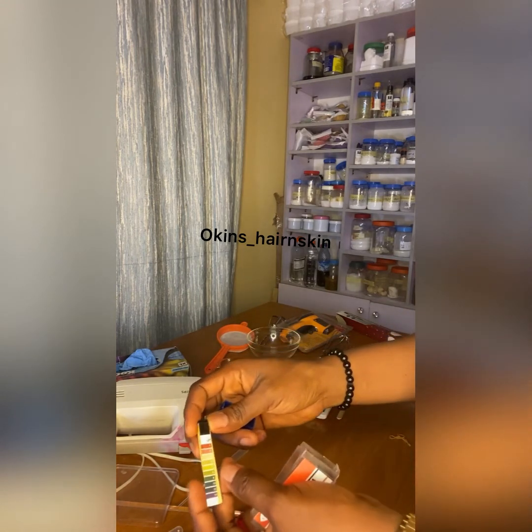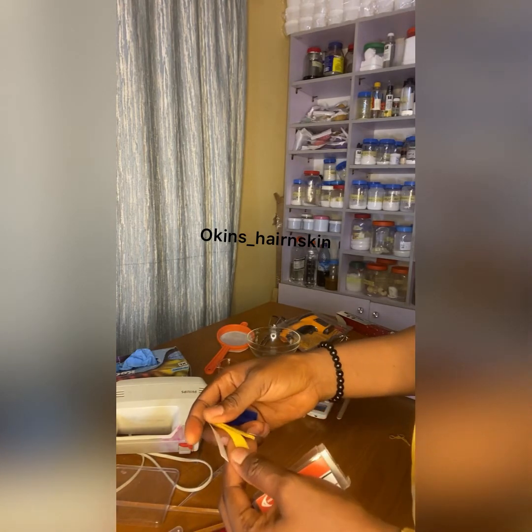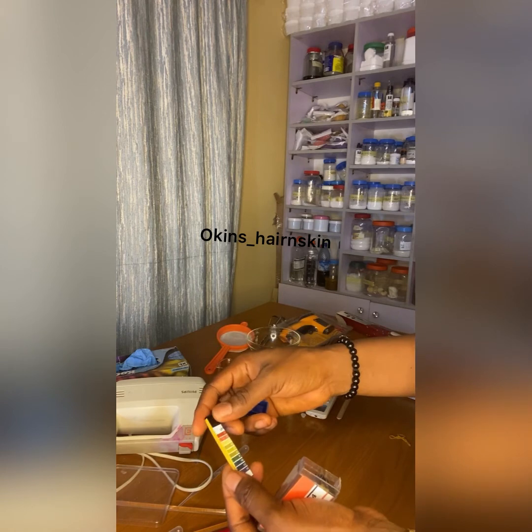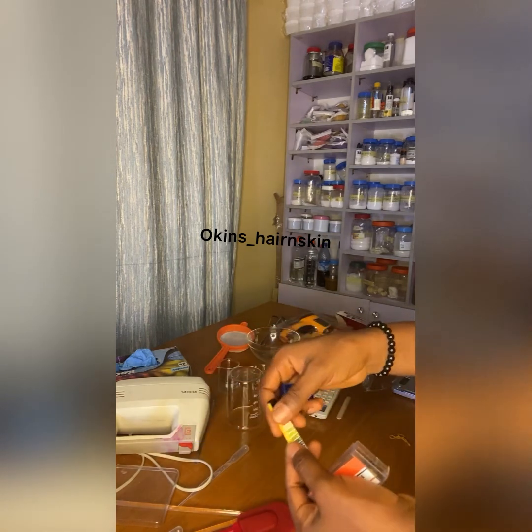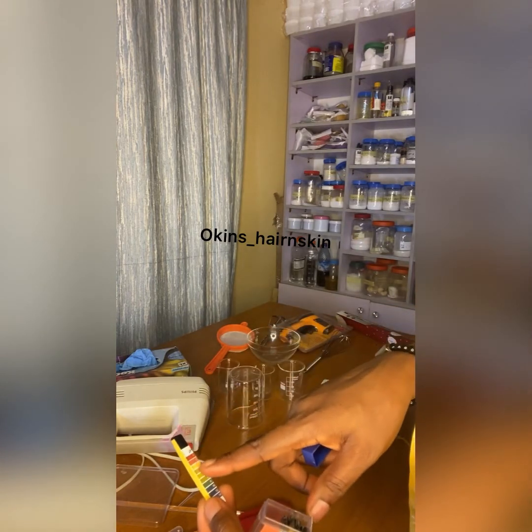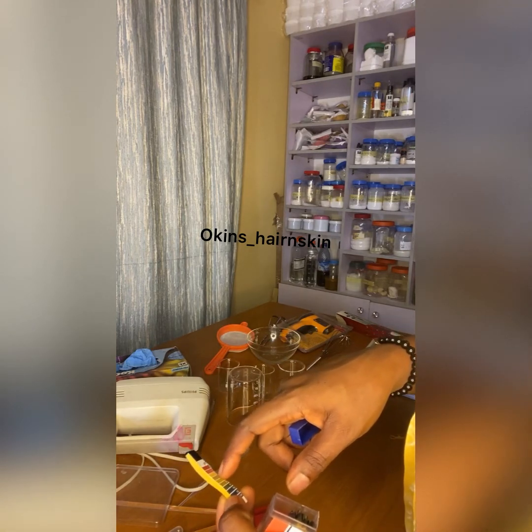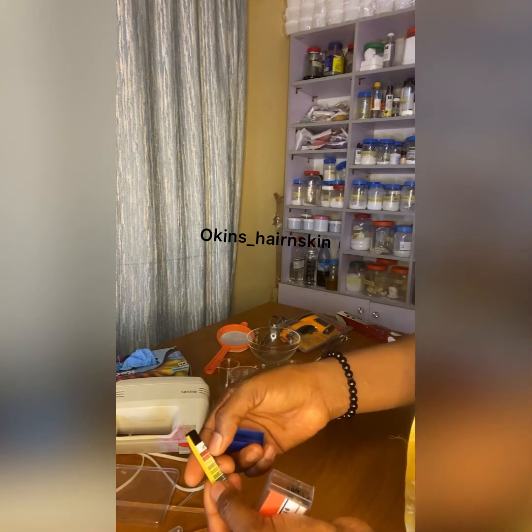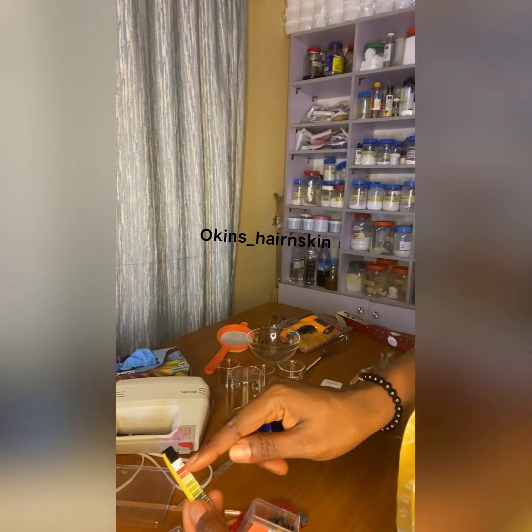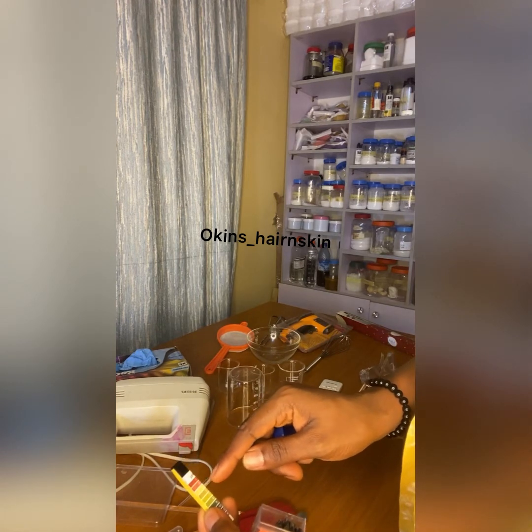So when you finish formulating, you pick one and put it inside your product. If it turns out the color it brings shows the range it is. So if it's between 1 to 6, it's acidic. When it brings this color, it's 1. When it brings this light orange, it's 3. When it brings this yellow, it's 5.